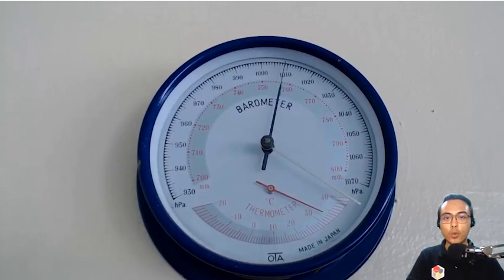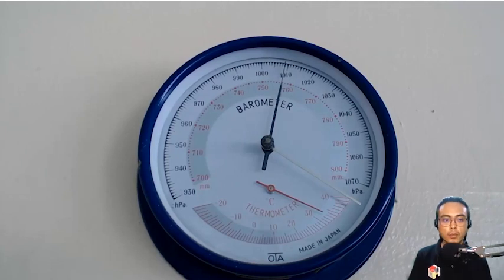This is how we measure pressure. This is called a barometer. If you take a look at the black arm, it would be pointing to some numbers. The black numbers are in hundreds of Pascal and the red numbers are in millimeters of mercury. For our purpose, we need the value of the pressure in millimeters of mercury and then later convert it to atmosphere. And with that, this demonstration of the experiment is over.